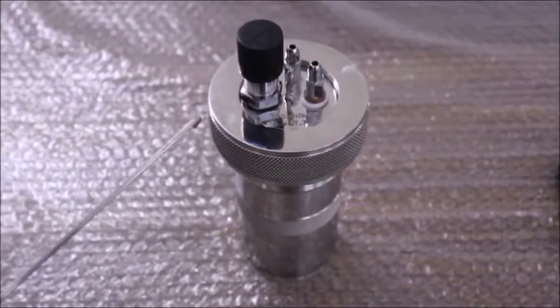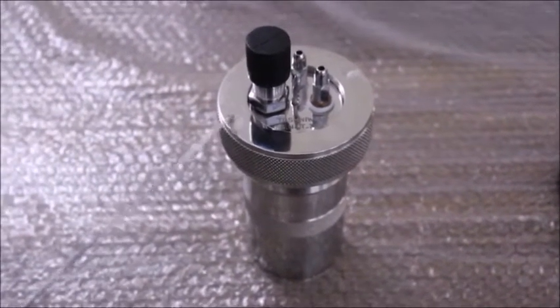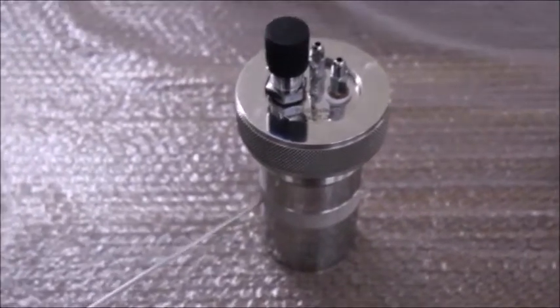Hi, welcome to Toshniwal Technologies Pvt Ltd. In this video, we will explain the application of a bomb calorimeter.